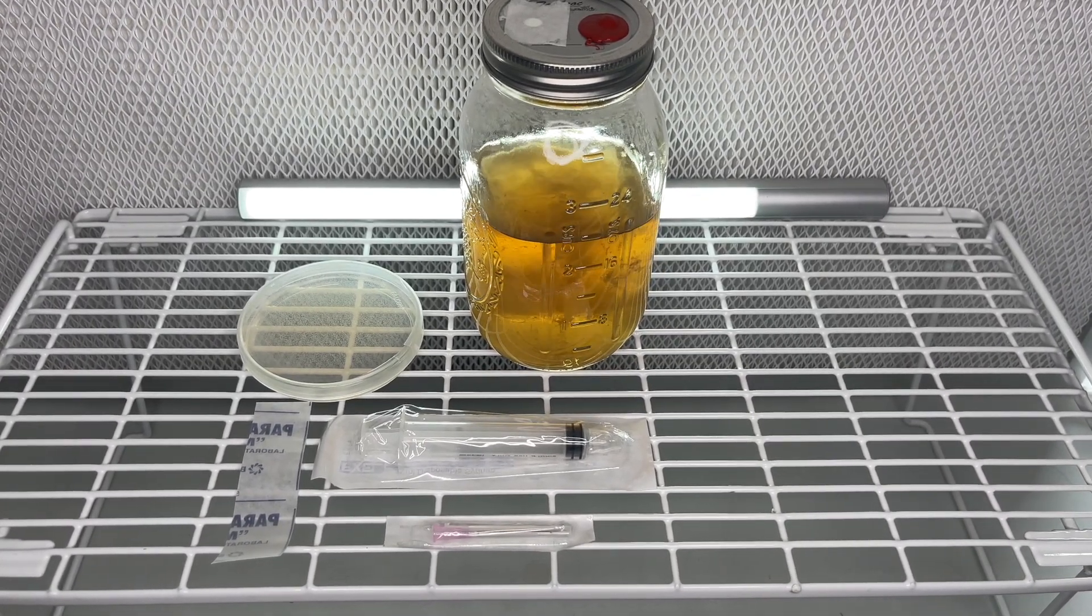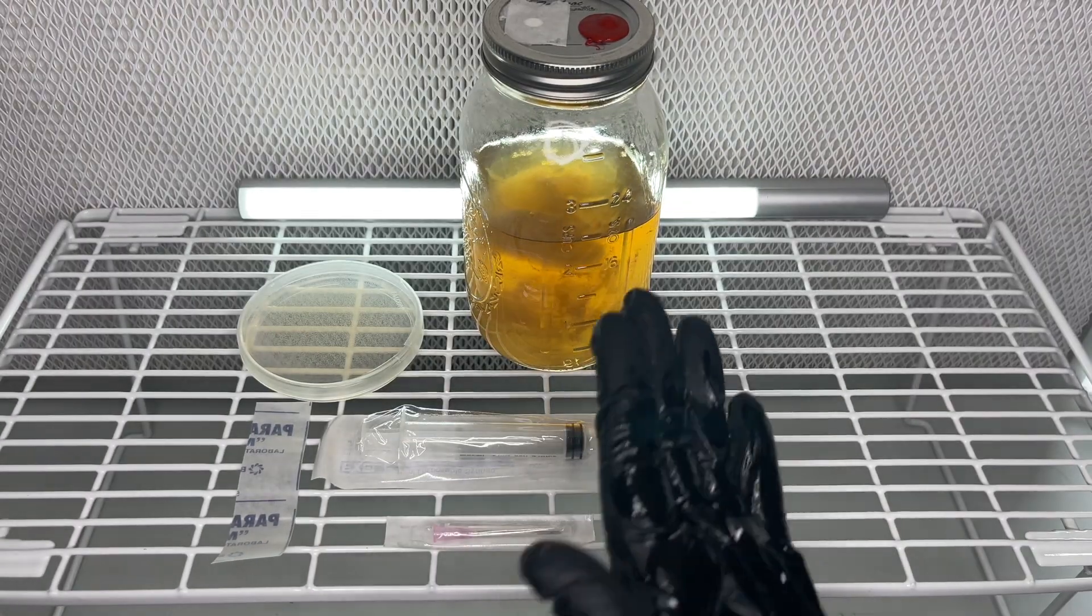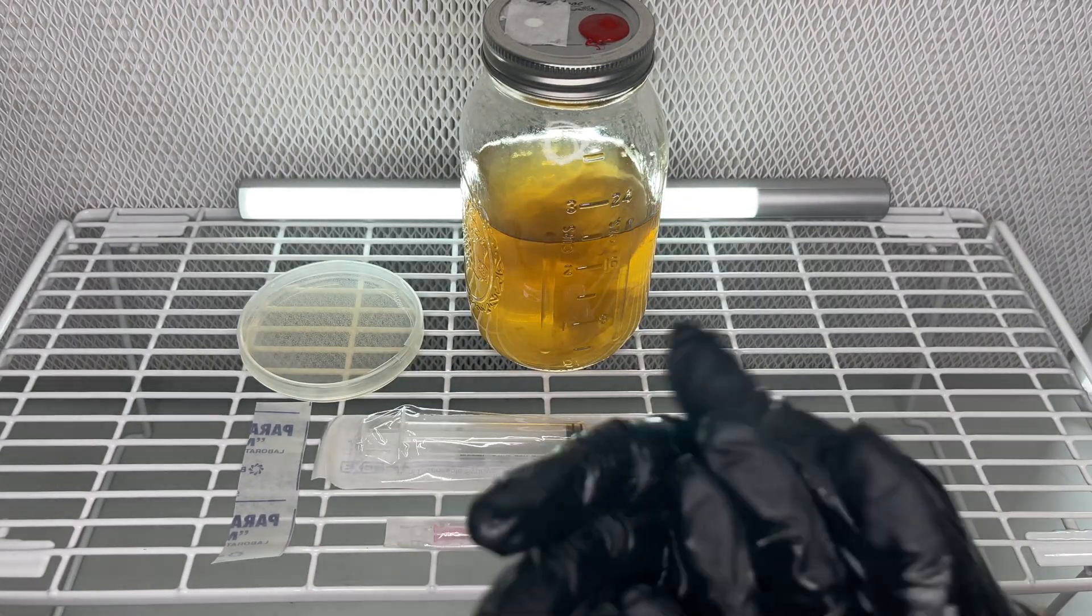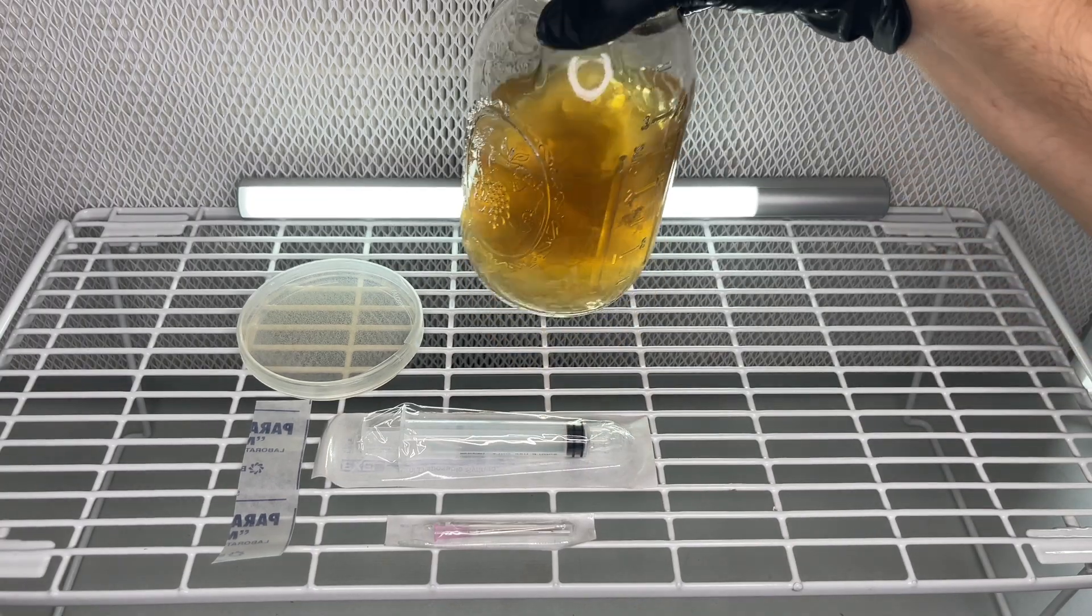Welcome back to Spore and Sproul. In this video, I'm going to show you one way that you can save a contaminated mushroom liquid culture or liquid culture syringe.